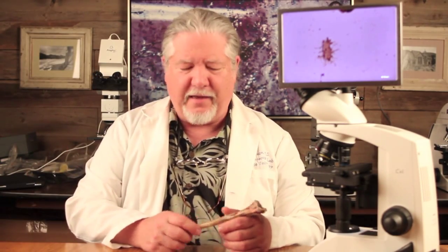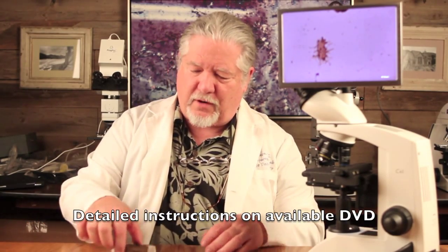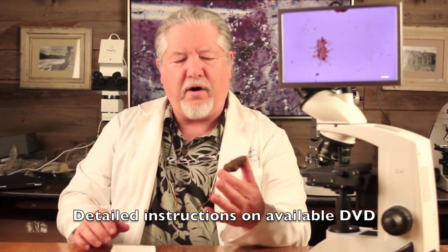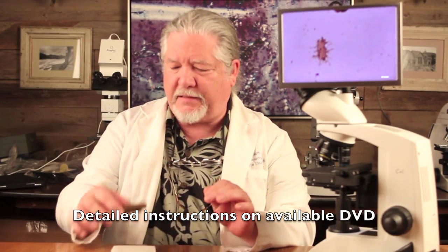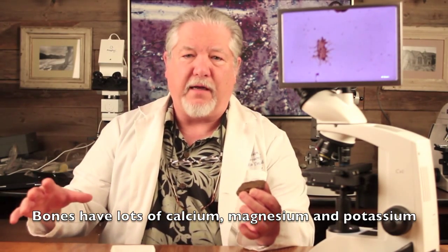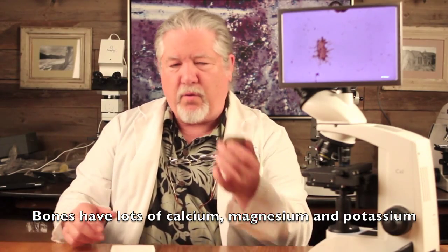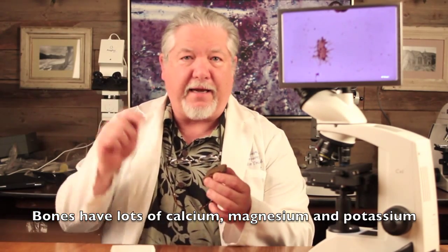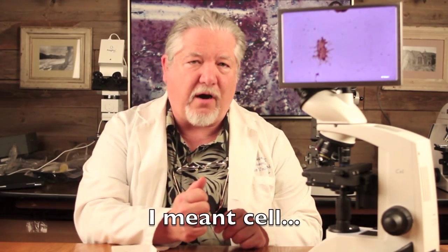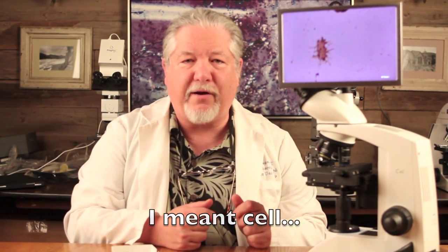He's enthusiastic, isn't he? It's an interesting bone, but not what we want to work with — we want dinosaur. Here I have a piece of a Triceratops horn that was broken off, and we're going to soak this in a weak acid, step by step, to get all the minerals off of it. Picture a piece of concrete with plumbing inside — we want to melt away the concrete and get to the plumbing, because that's where the soft tissues are. Eventually you'll have a solution you can pipette onto a slide and view under your microscope.